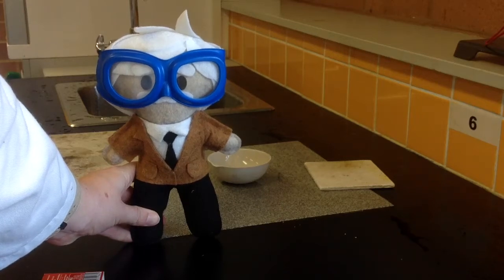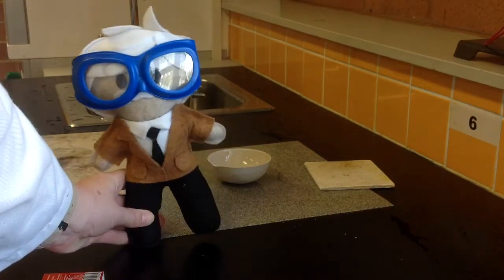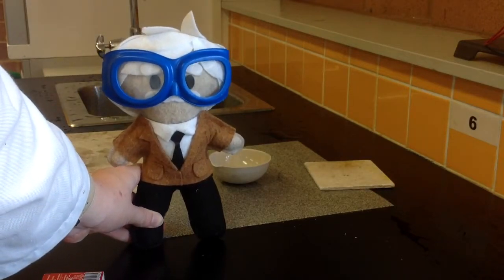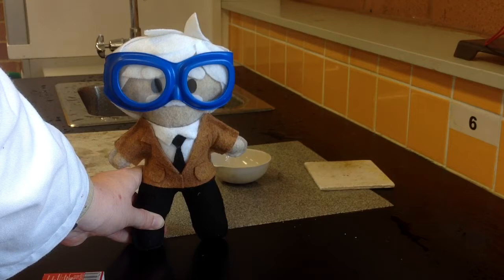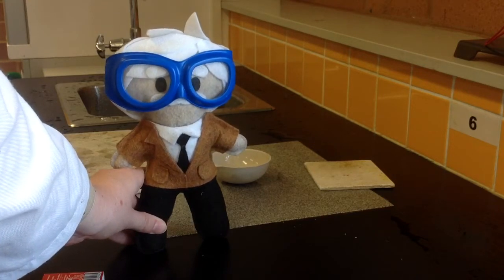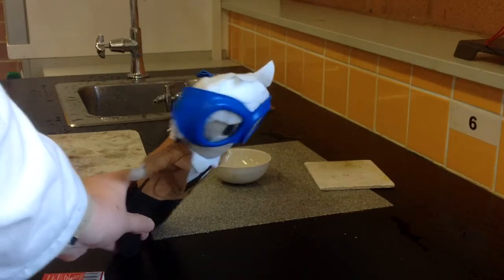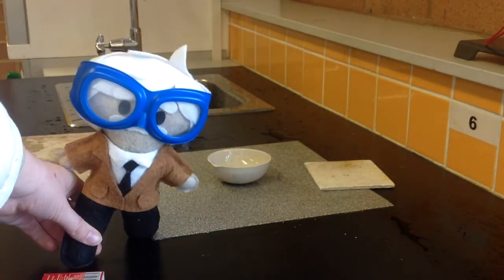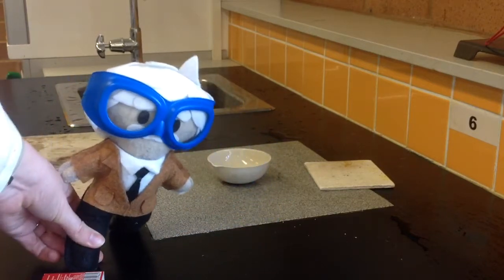Welcome back to Science with Mrs. Crane and Mr. Einstein. What we're going to be looking at are a few more chemical reactions that we see happening. Now these ones involve fire, and so Mr. Einstein is going to take a little bit of space back because he's flammable and we don't want him to burn.